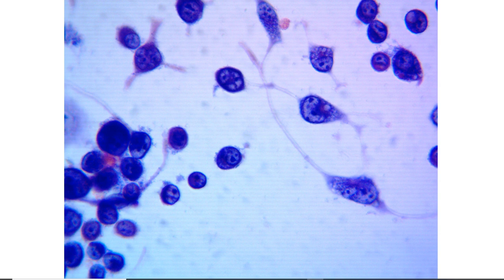So microscopy is not just used to look at, hey, there are some cells, look how pretty they are. You can actually make lots of different types of observations from them. And you can look at lots of different things, just morphologically as well as measurements quantitatively. You can look at number of nuclei, number of nucleoli, presence or absence of vacuoles. You can look at how the cells are dying, how well the culture is surviving a particular treatment, if they're differentiating or not. So lots of things that can happen, simply by looking at these slides.